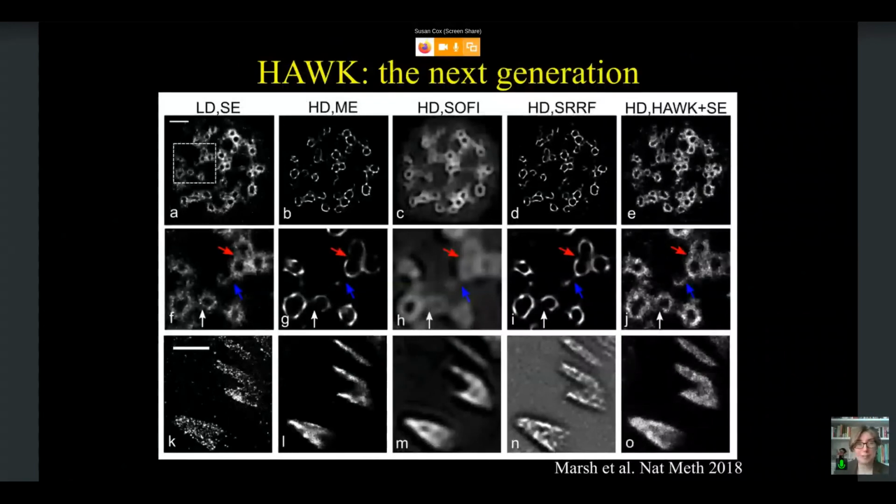So when we analyzed these results, we were able to show the low density results on the far left, you see, are quite almost one might call diffuse. There are large areas that are white. We are not getting very sharp lines. We are getting a lot of structure over quite a wide variety of distances. And we have structure like the bit coming off the little group of 3 podosomes that I've shown with the blue arrow. And if we look at the high density image on the far right, you can see we see a very similar structure to that far left image.